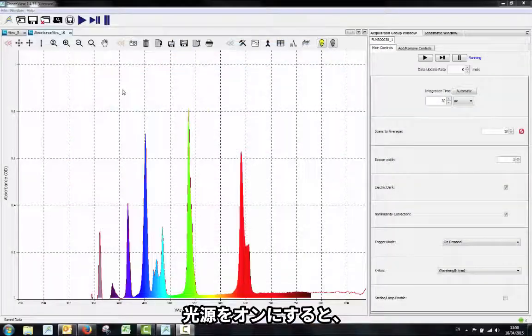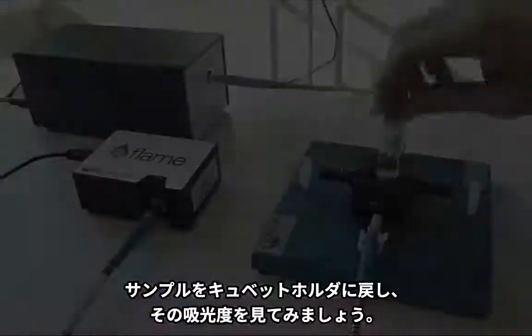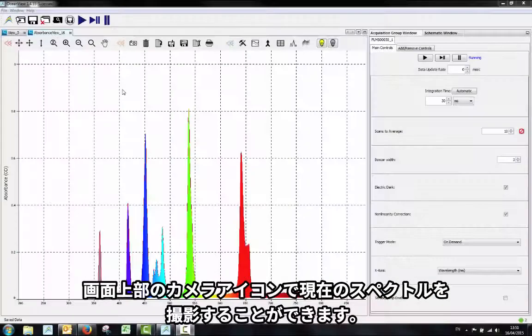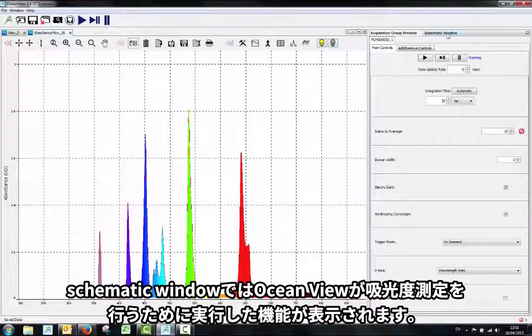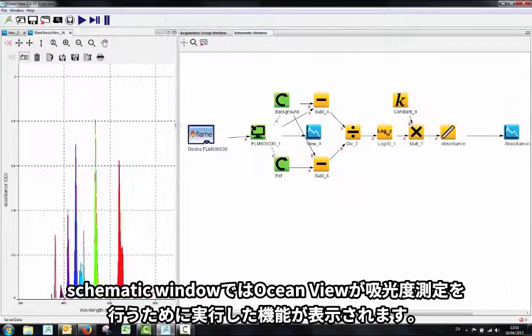With your light source on, your referenced absorbance measurement can now be seen in the Absorbance View tab in OceanView. Place your sample back in the cuvette holder to take a look at its absorbance spectrum. You can capture the current spectrum using the camera icon at the top of the screen. The schematic window shows the functions that are being performed by OceanView in order to get your absorbance measurement.